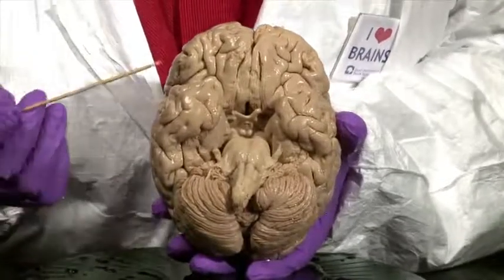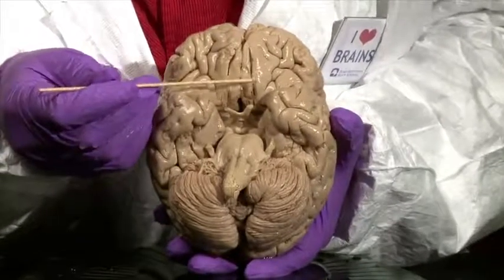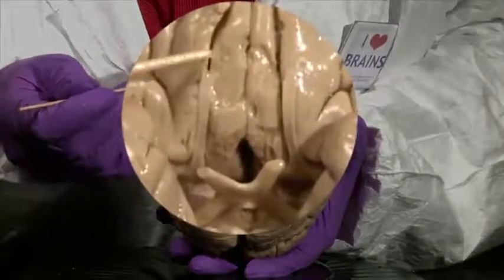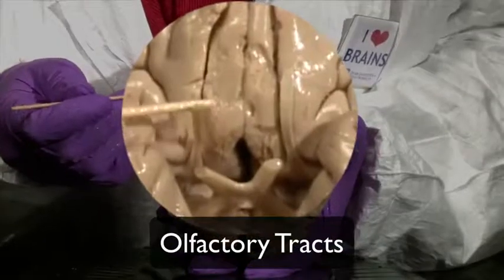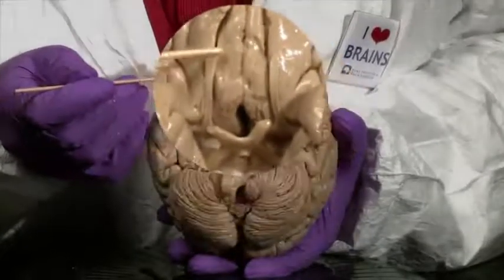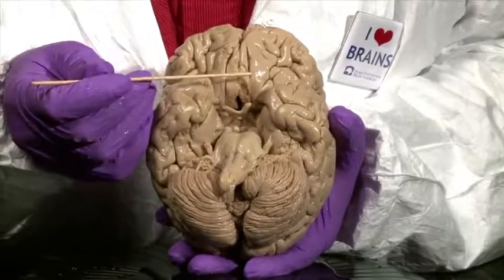So towards the front part of the brain, the first set of structures that we can note are these two long tracts on either side of the midline that sit on the bottom of the frontal lobe. These are the lateral olfactory tracts that terminate in an olfactory bulb. And as those names imply, these structures have to do with our sense of olfaction, or our sense of smell.